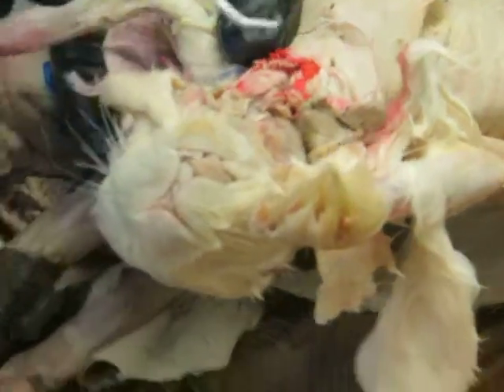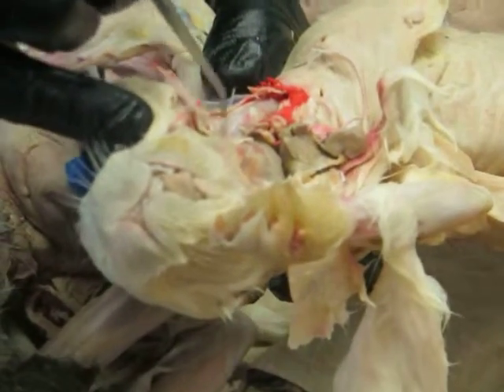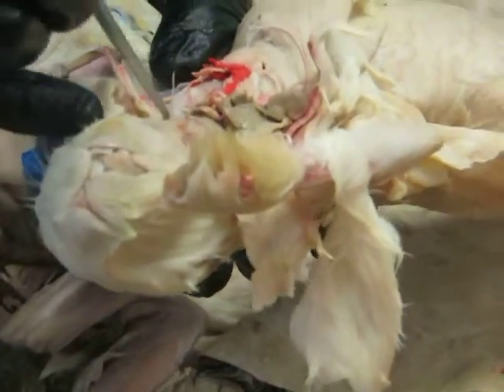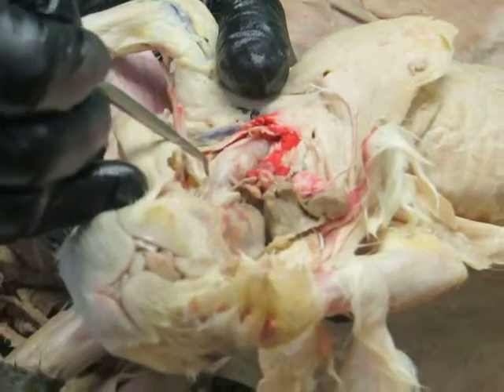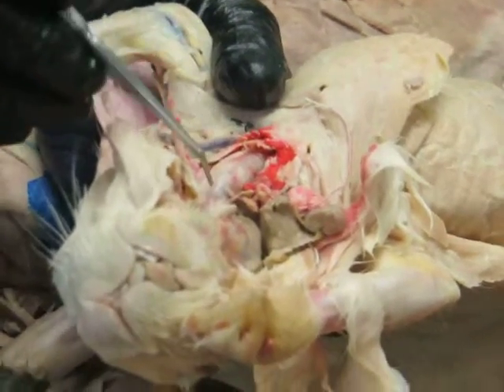Okay. If we flip these back, the sternohyoids, you can see the hyoid itself, the hyoid bone, is up right in this region. You can see where they're attaching, right in there. Okay. And below that is this big cartilaginous structure, and this is the larynx or voice box, and we'll get to that when we get to the respiratory system.